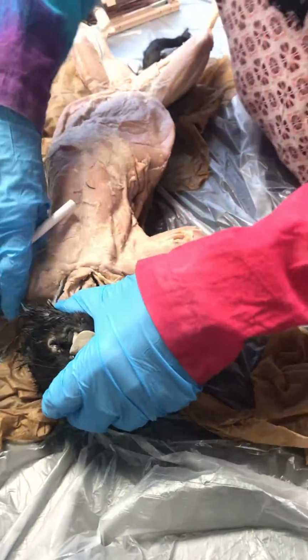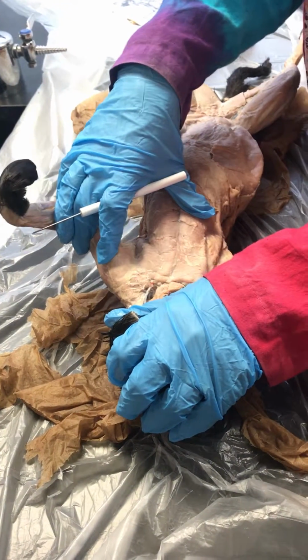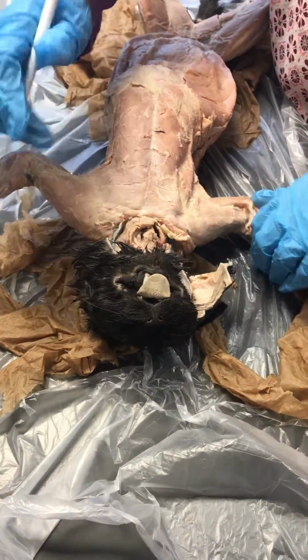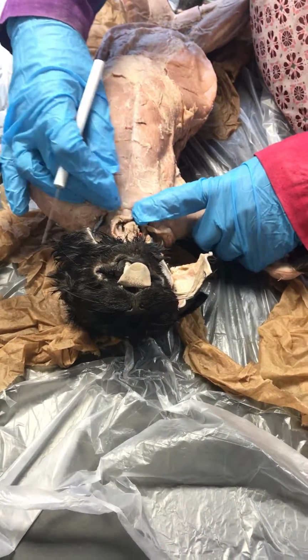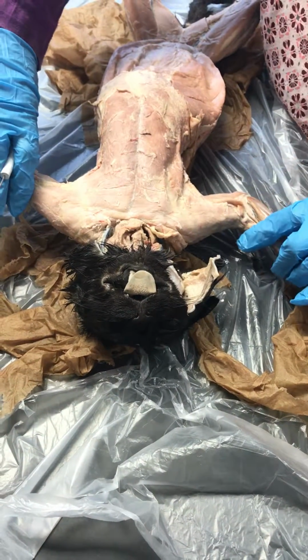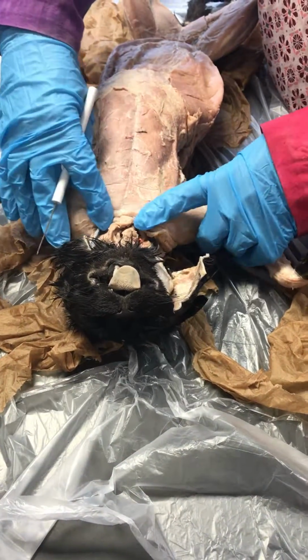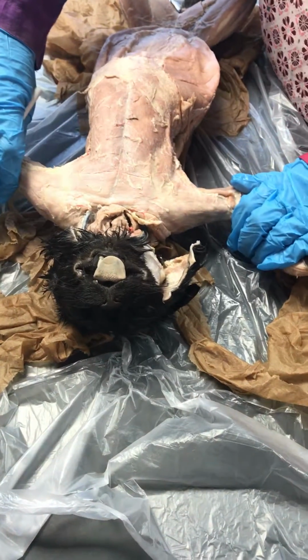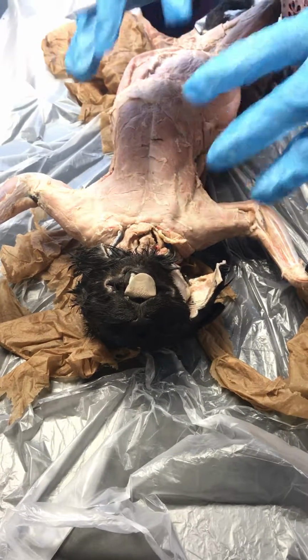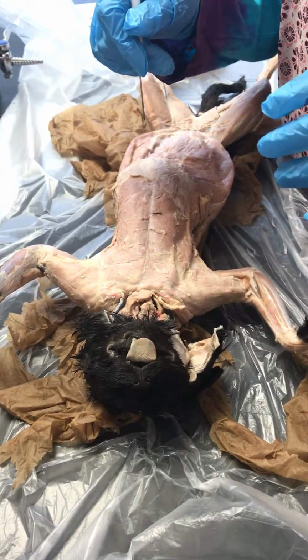Okay? Now, will I possibly put a pin in the clavobrachialis more than once? And it is a possibility, because you can see the clavobrachialis in the front. That's this muscle that's right below the neck that's coming all the way out to your elbow joint, but it sits on top of the shoulders. So the clavobrachialis is this muscle that sits on top of the shoulder and comes out, and you can see it on the back of the cat too. So it is a possibility that I actually have this identified twice. Okay?